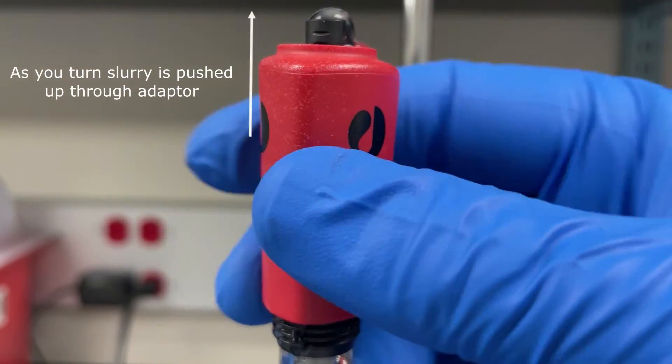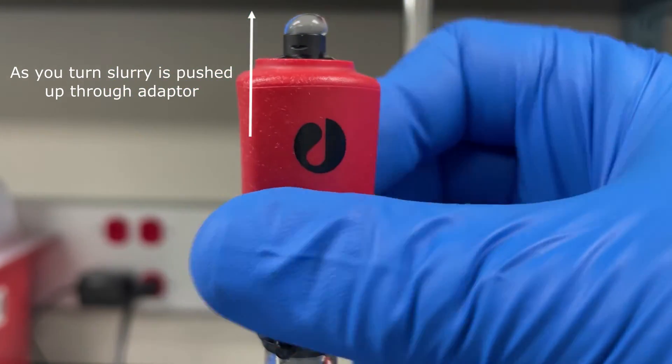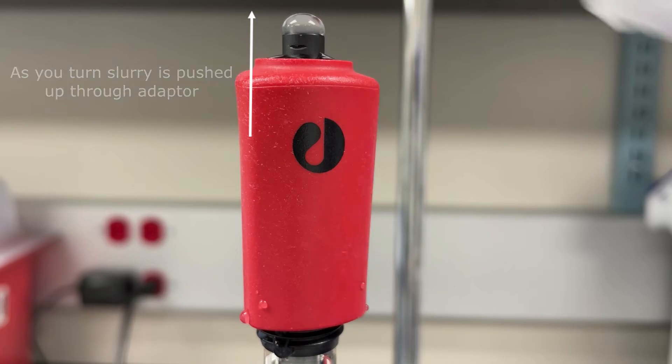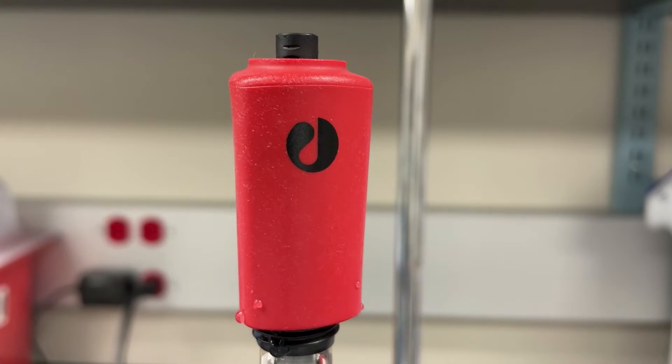I reset the camera so you can see that there's resin coming out of the top adapter, and this is just because we don't have a filter on the top adapter. If we put it on right now, the filter would pop off the top adapter and float down into the column, so we just have to be careful to only run the column down on the chromatography system.